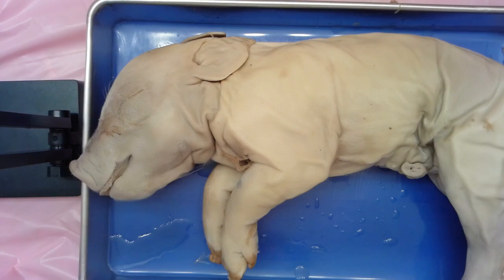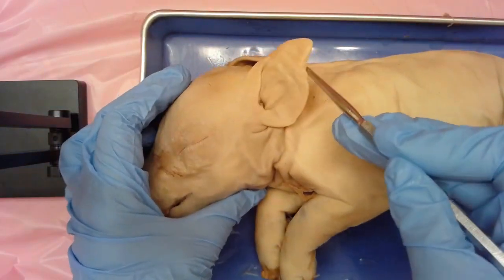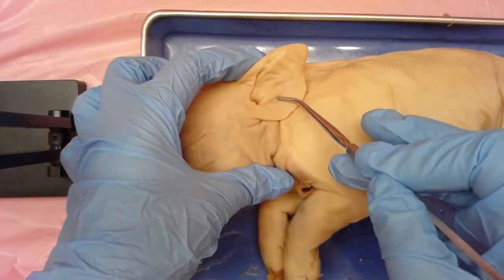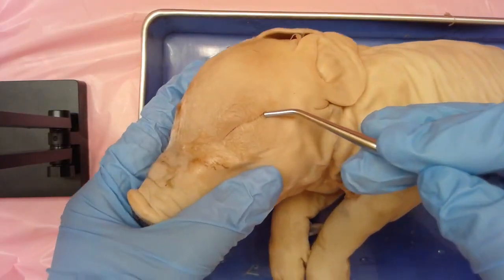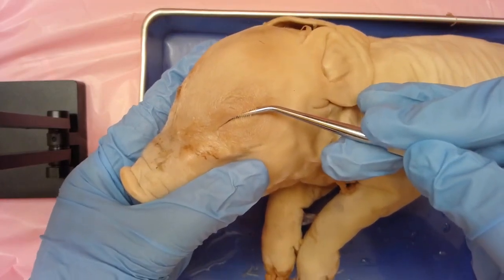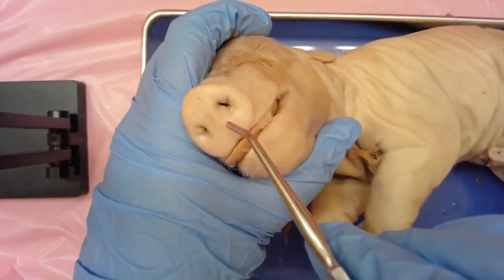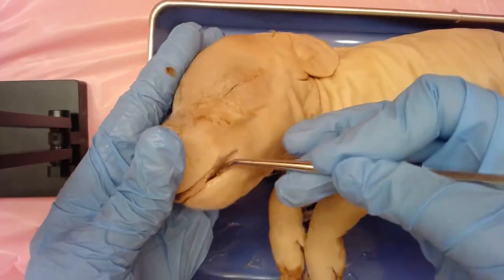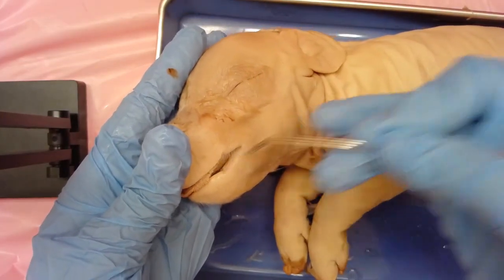We want to look at the head region and note some different structures. First, you see there are ears — we call the external ear the pinna, P-I-N-N-A. We can also see that there are eyelids that are closed, and if you notice, there are little eyelashes that are visible. In the snout, you'll notice there are two nostrils. It's kind of hard to see here, but there are also teeth that are plain and sharp on the inside — a few teeth have already developed.